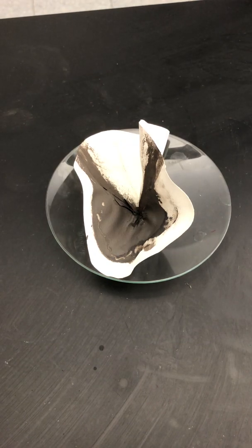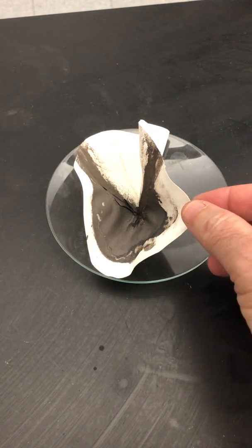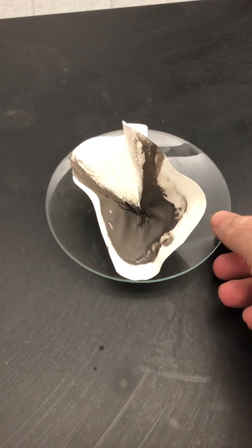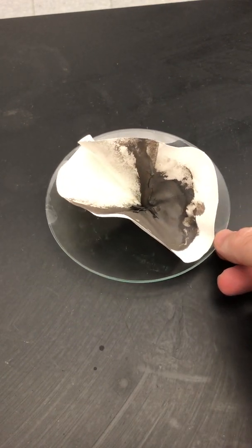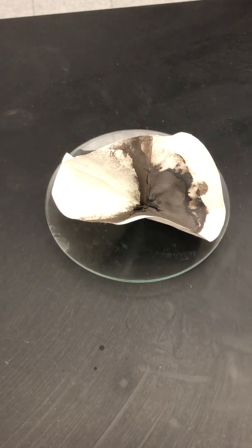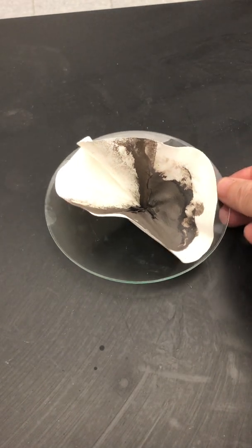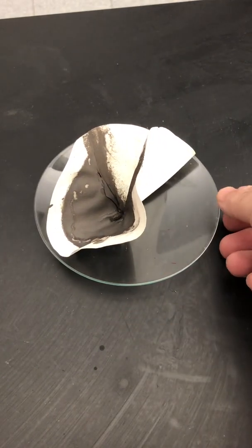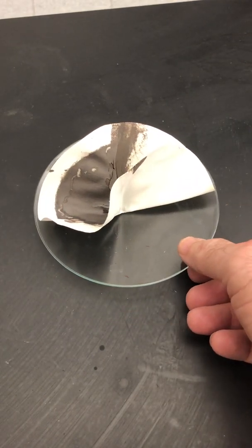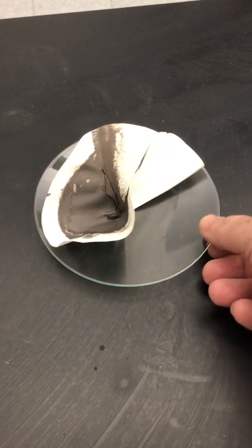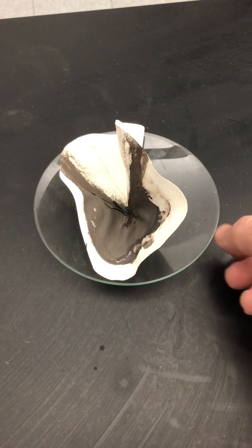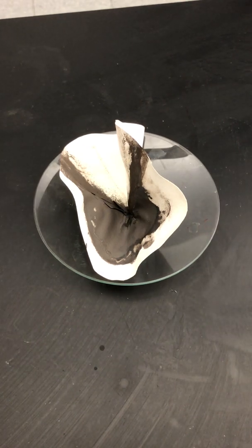Here is our dried up filter with our copper 2 oxide product. It will be very dry and very dark. One important thing to observe is that there shouldn't be any yellow residue on the filter paper. If there is like a yellowish color on it, it probably means that you did not rinse out the excess NaOH completely. And because of that, some of it essentially vaporized and you have residue of solid NaOH in here. This one looks very good. What I'm going to do is I'm going to bring it to the balance room. I'm going to weigh that filter paper with the copper 2 oxide product. And I'm going to go ahead and do my calculations.